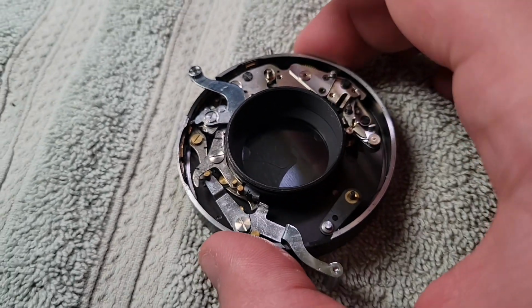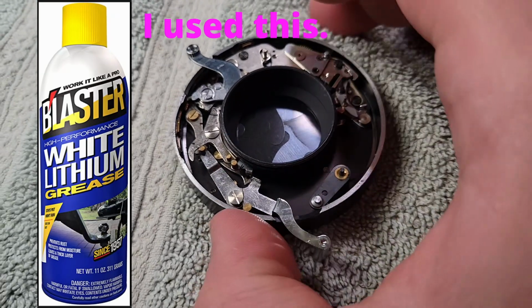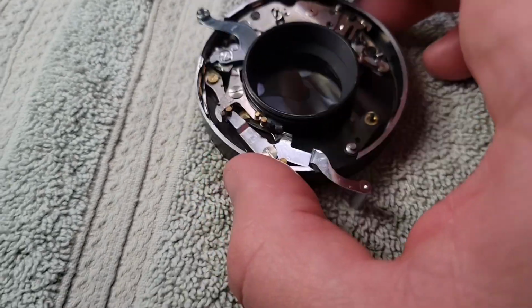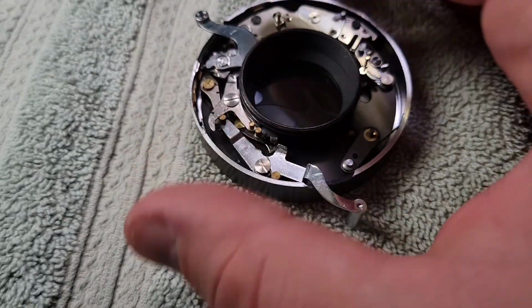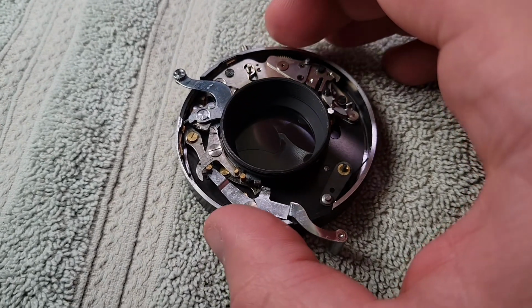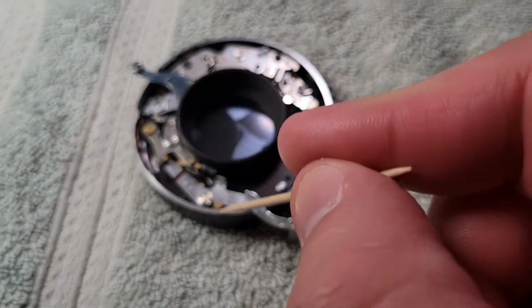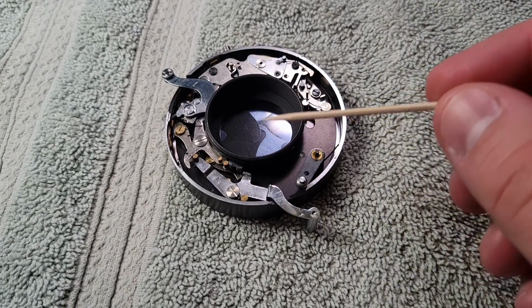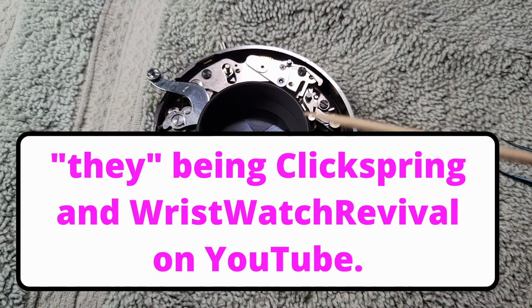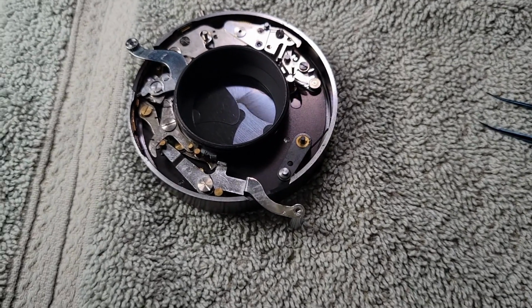I've been told that white lithium grease is what to use for this. I'm waiting on a second opinion of that, but I'm pretty sure that's probably what I'm going to go with, because that sounds pretty cheap. In fact, I have it in my garage right now, and it sounds like it's viscous enough that I can get it on here, but not so viscous that it's going to affect any of these parts adversely. They'd probably be able to tell you exactly what's going on here, but I can't. I don't really know what is going on there other than there's a thing doing a thing.